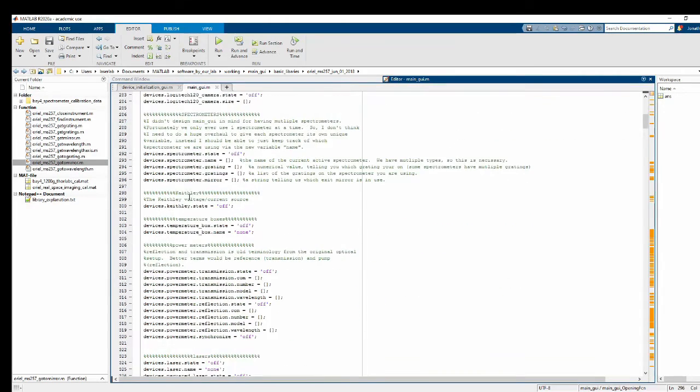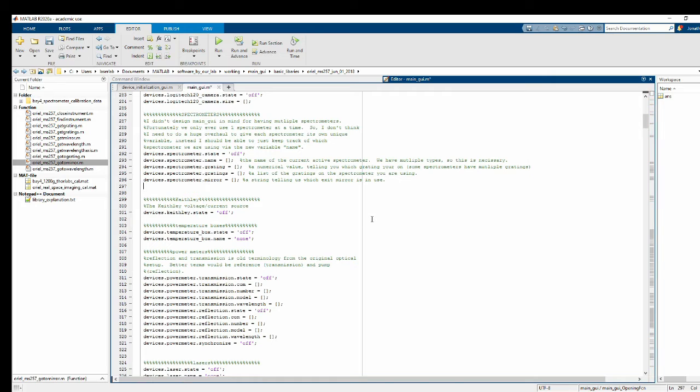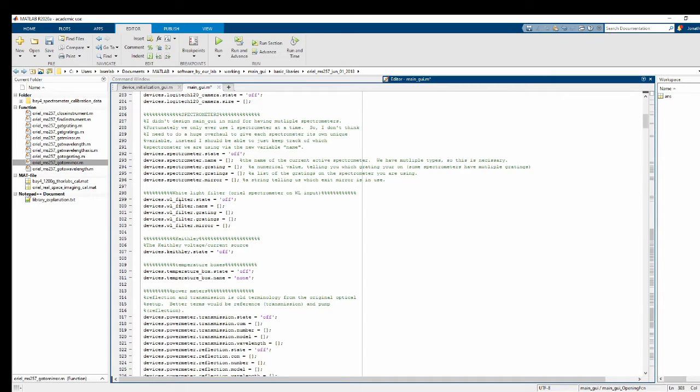Now, it doesn't matter where I put it, but since the Oriel white light filter is really just an Oriel spectrometer, I'm going to put it pretty close by, just right underneath. And now you can see I'm calling this device the white light filter, and then there's the state variable that says if it's on or off. This will become on once we initialize communications. There's the name, there's the grating number, the gratings list, and the mirror, which is the exit port that's being utilized.